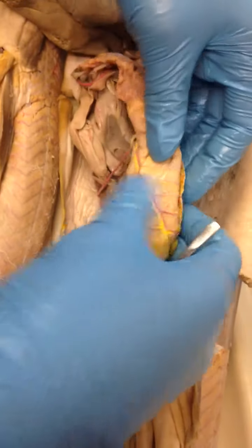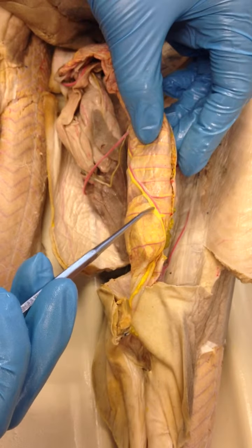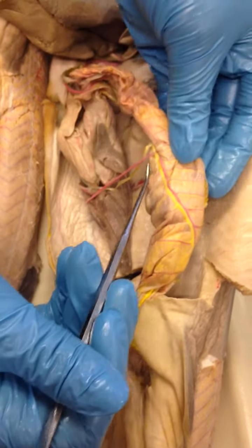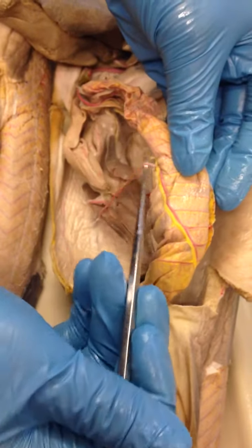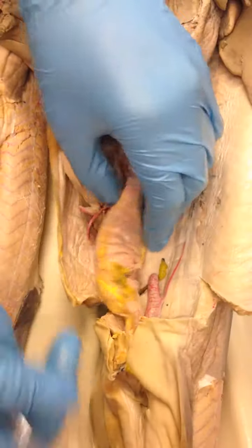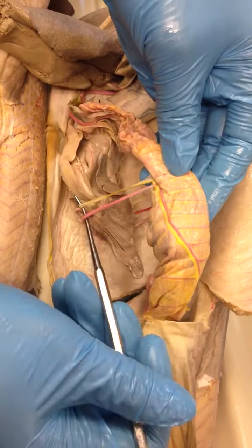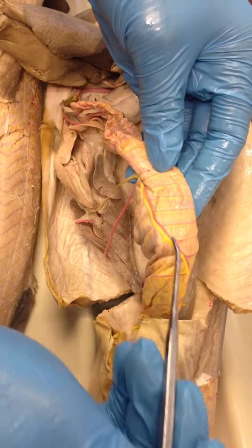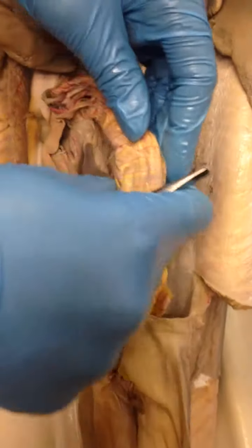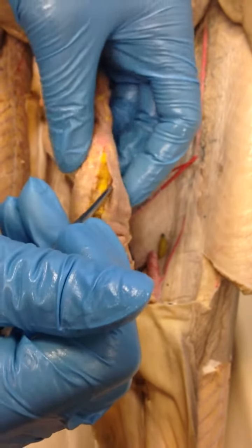If you flip the intestine over and you see this artery here, it's at the bottom, and it would be called the posterior artery. So the posterior artery stretches all the way down here, but it extends out. That's the difference between the anterior and posterior. There's no extension on the anterior, it just goes all the way down here. The posterior comes here and kind of goes out. So this is the posterior mesenteric artery.